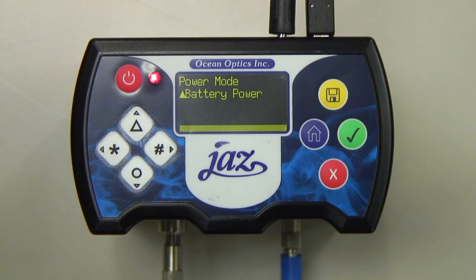The advantage of using External Power Mode is that it enables you to utilize the full capabilities of the light source. This includes setting the intensity control up to 600 volts and the pulse rate to up to 500 Hz.